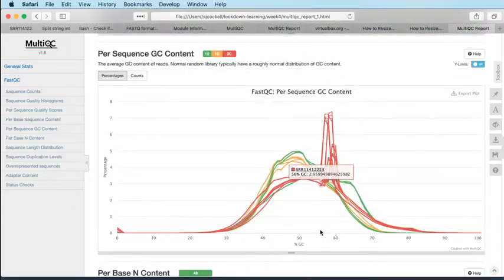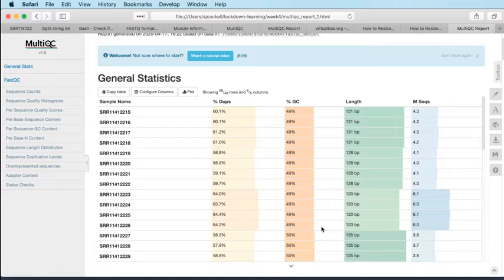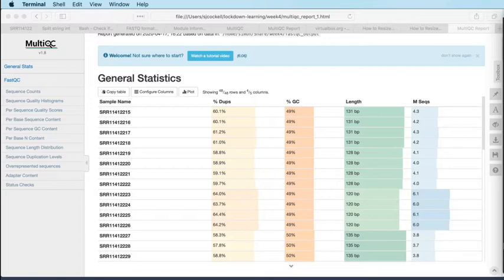So I think overall, the quality of this experiment is very good. It is clearly an experiment of two halves, and that's fine. We've got two conditions. That's okay. And so I think that we can work with this data. It looks okay to me, so that's good.